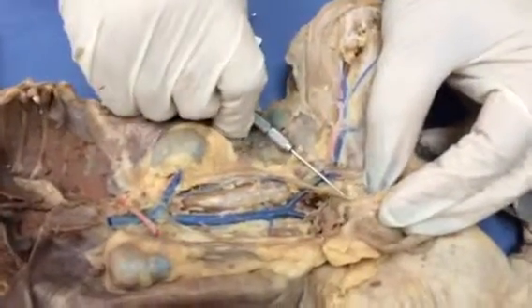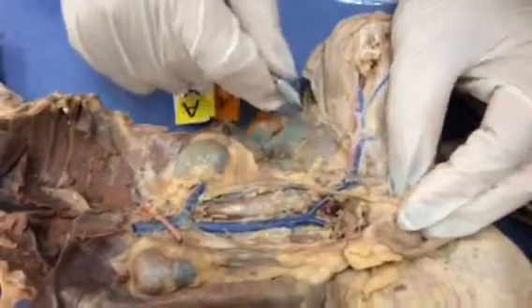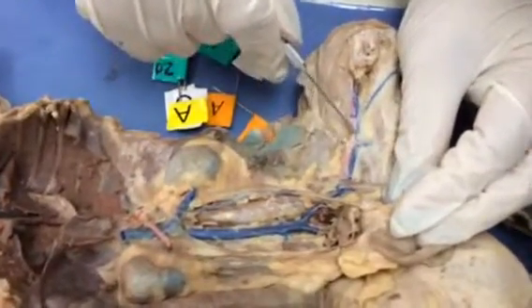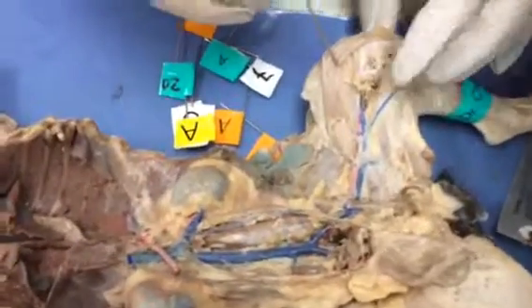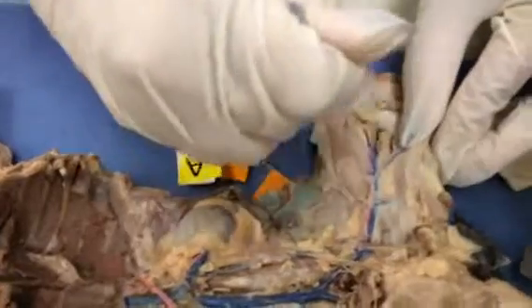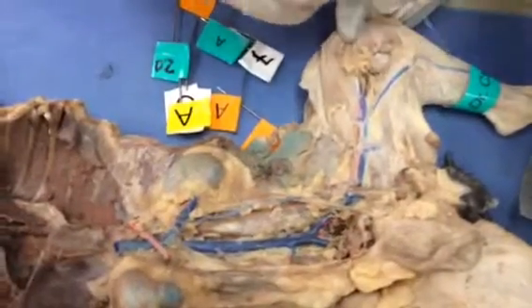Once we pass the inguinal canal, the external iliac becomes the femoral, with the deep femoral branching off, and continues its journey into the thigh. Above the knee is called the superior articular. Behind the knee is called popliteal. When it goes all the way to the inner thigh, then it's called the saphenous vein.